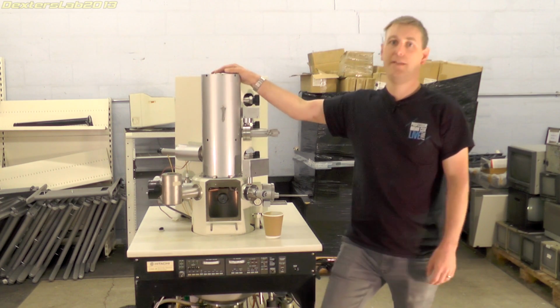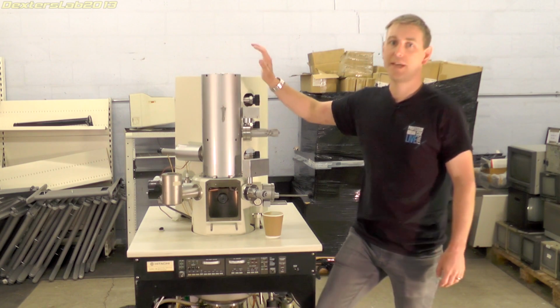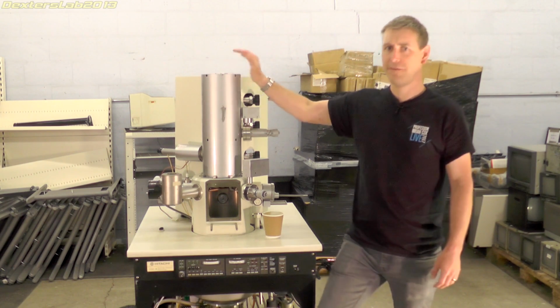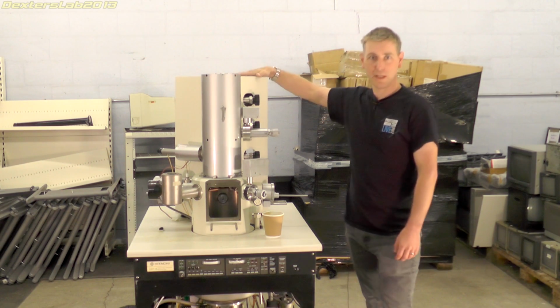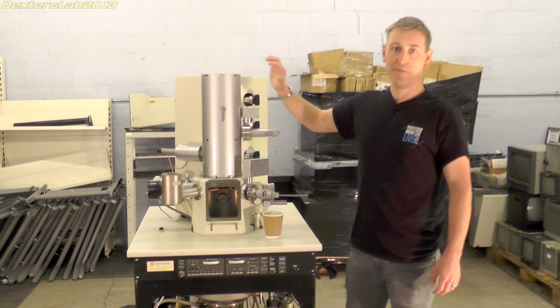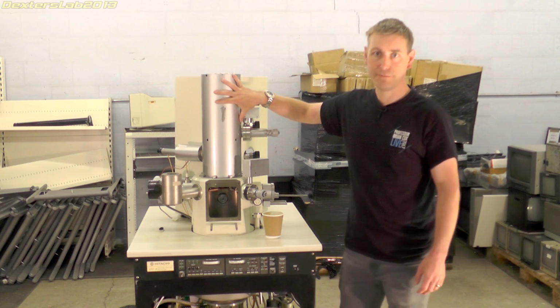This cylinder is the electron gun and column assembly. This contains the main electron gun, beam control, focusing, and the scanning coils. Attached to the back are three ion pumps underneath these covers. These allow you to pump the three main chambers inside the column down to a very high vacuum.